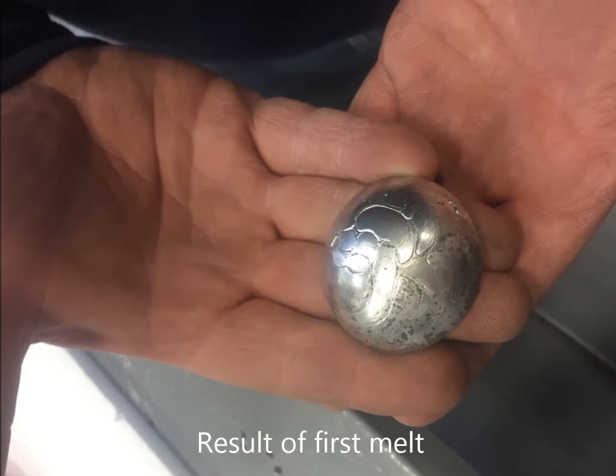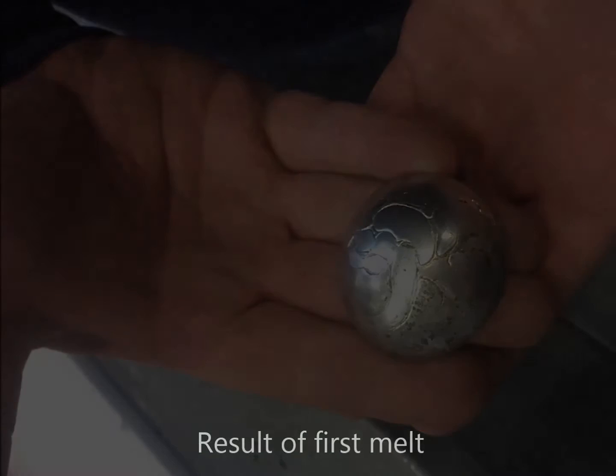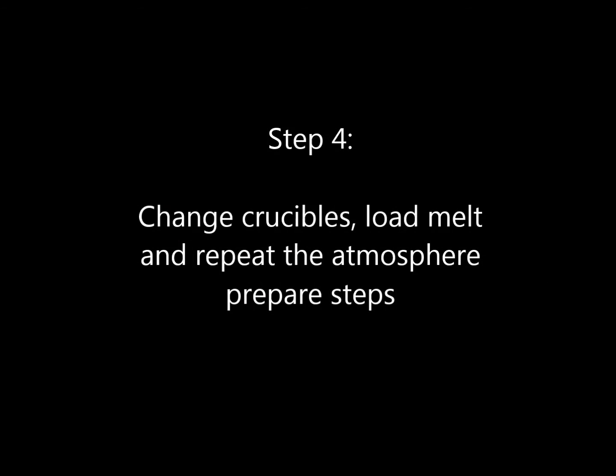After the button has cooled, the hearth is changed out and replaced with the casting mold.